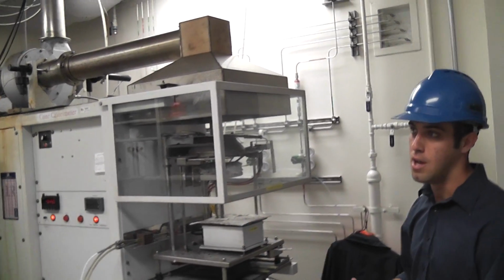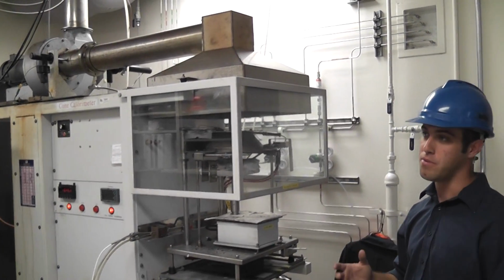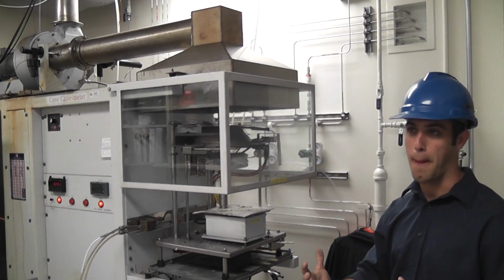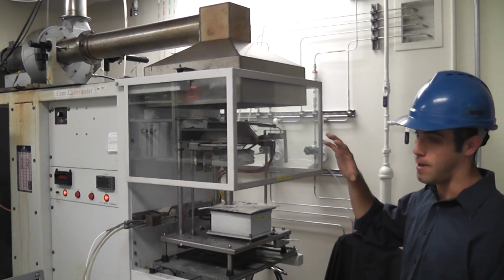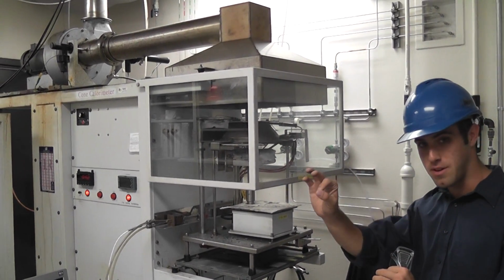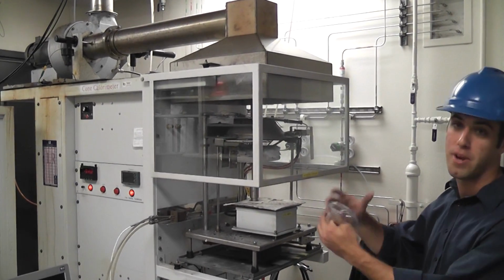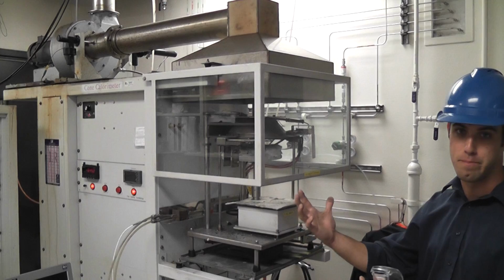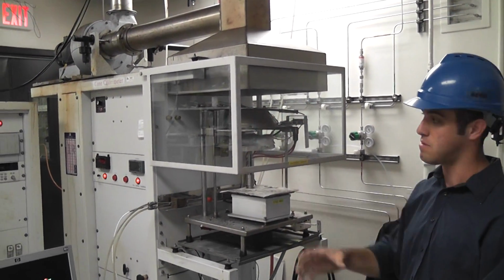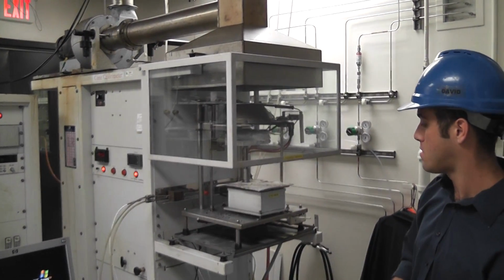And just something in the context of the other tests that I've spoken about: the large scale tests and the radiant panel I just showed you, those are all tests of assemblies. Those are combinations of products. It's important to distinguish that from this test, where this is a test of a material. You put one material in here to characterize how that material behaves. You wouldn't put a combination of materials in here, at least by any test standard. Those are all assembly-based simulations. So that's a main difference between this small guy and those large-scale fire resistance tests.